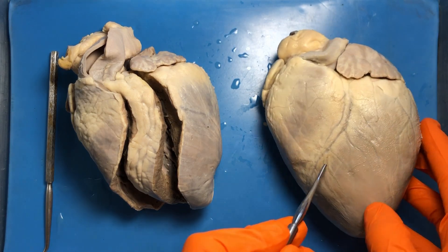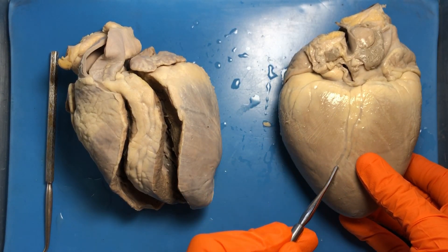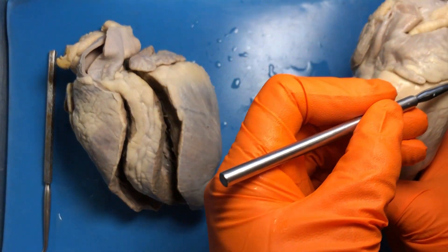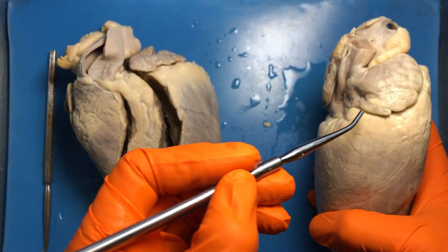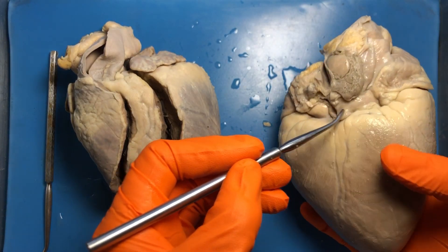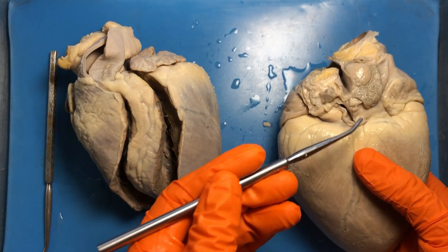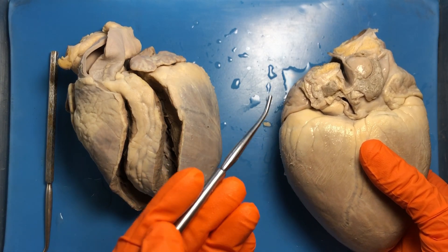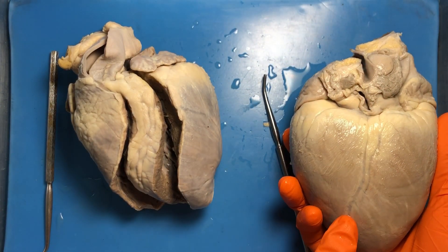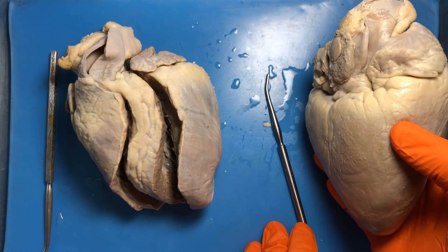The posterior interventricular sulcus is on the back side. We also have another sulcus that goes around the circumference of the heart called the coronary sulcus. The coronary sinus — that large vessel on the posterior side — sits within the coronary sulcus. So remember: anterior interventricular, posterior interventricular, and the coronary sulcus going around the circumference.